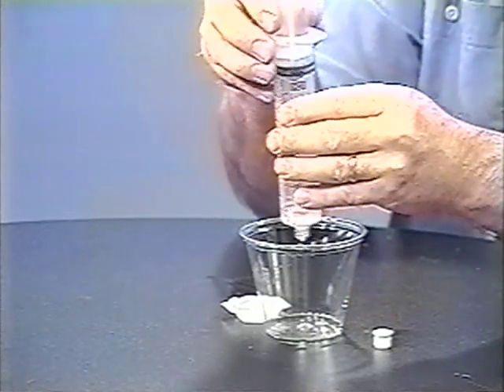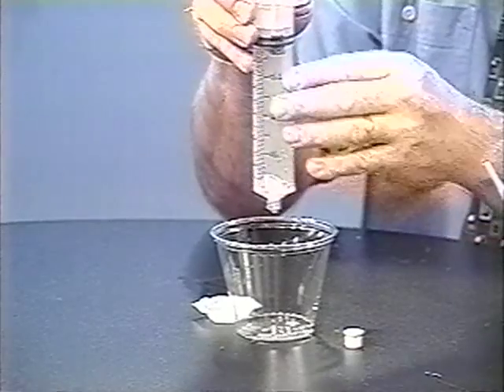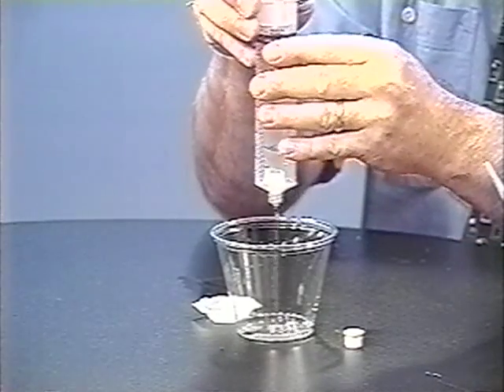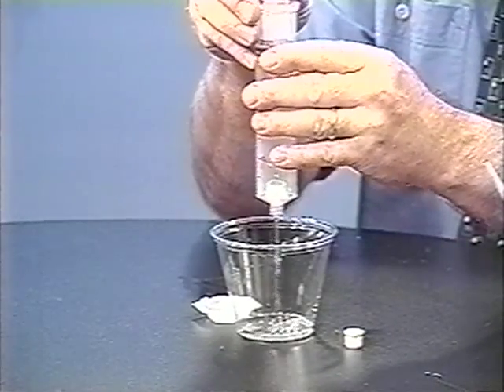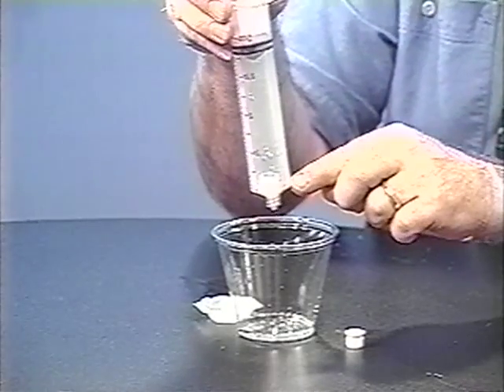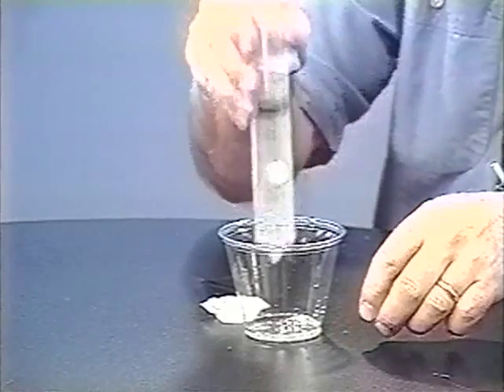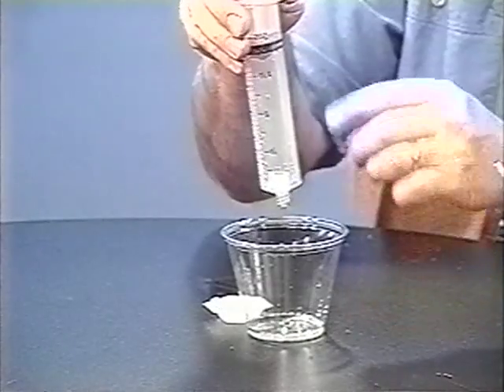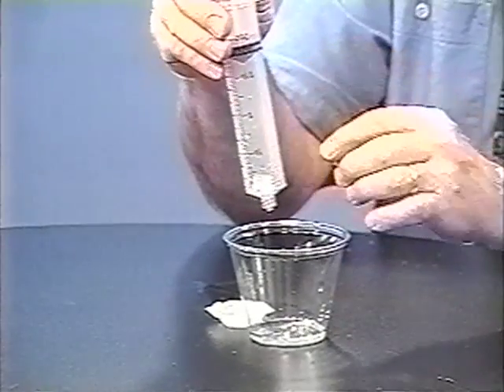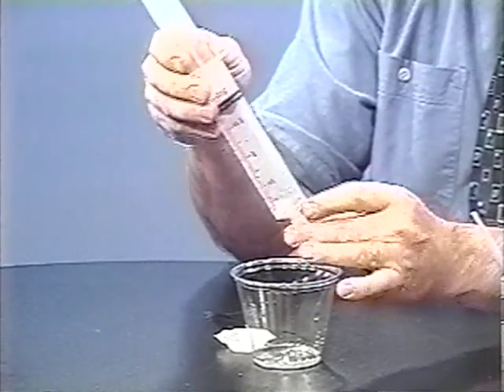I'll take the cap off and discharge the reagents downward into the cup. It's not so bad with vinegar and baking soda, but when you're using hydrochloric acid or a reagent like that, you certainly don't want that on your fingers. Sometimes the little vial cap inside lands on its feet and there's water or solution trapped inside — just shake it a few times and that comes out. You won't get every last drop out and you don't want to discharge any of your gas, so after it looks pretty good, put the cap back on.